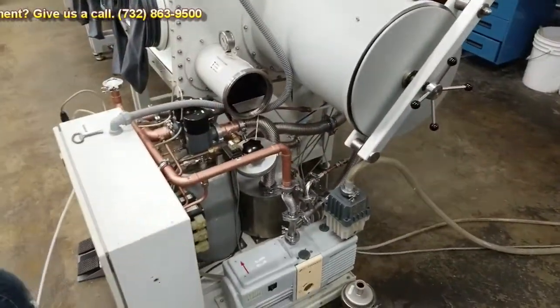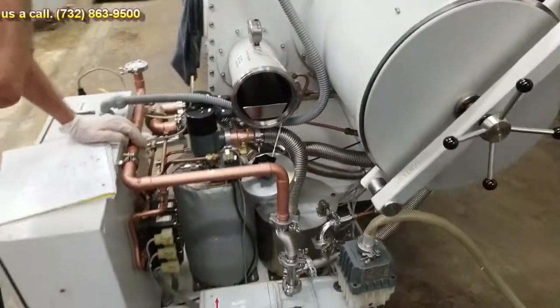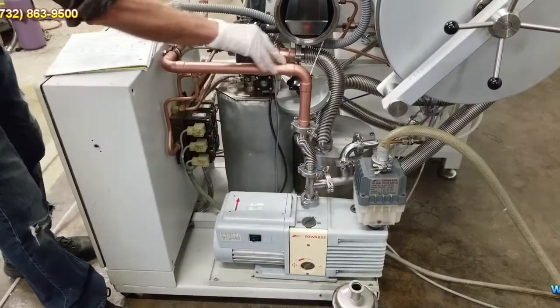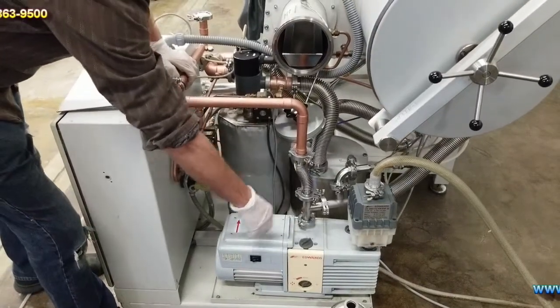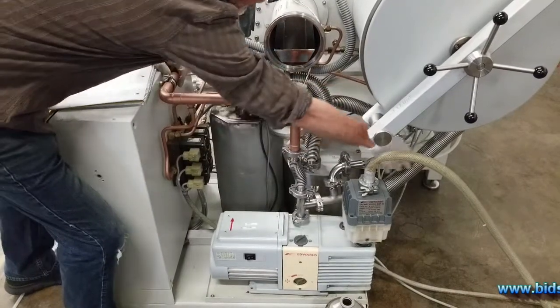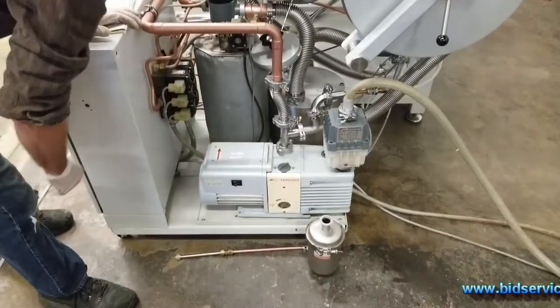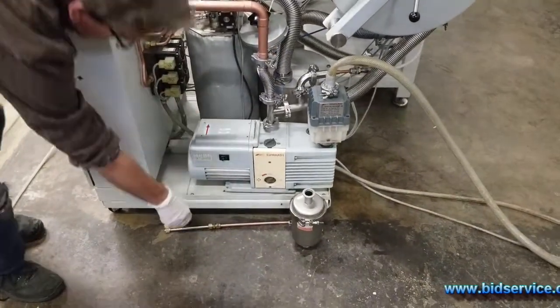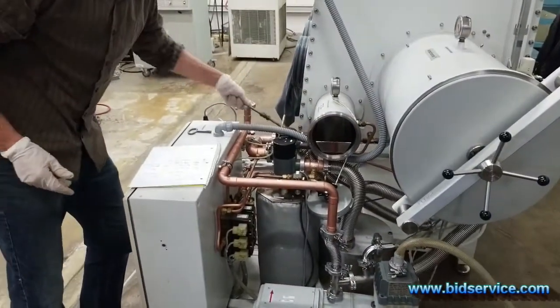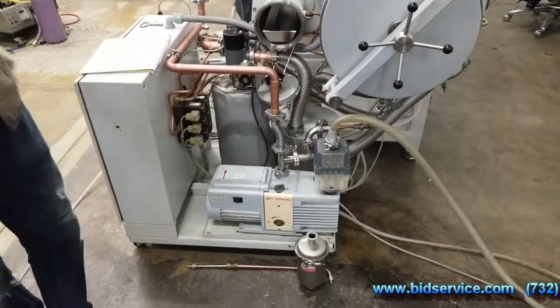larger antechamber. So since I blanked that off, what I had to do is add this manifold setup here over to directly at the pump. This is basically a pump out line, roughing pump line. So what I did is I teed one line going to our antechamber, and then another one going up to the valve in the back. I had to take the sieve trap off. I'll send that along, and the only pipe I actually had to take off was this, which would fit in here. So I'll send that along, in case you ever decide to put it back underneath.